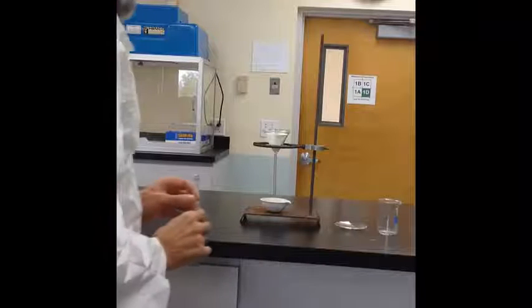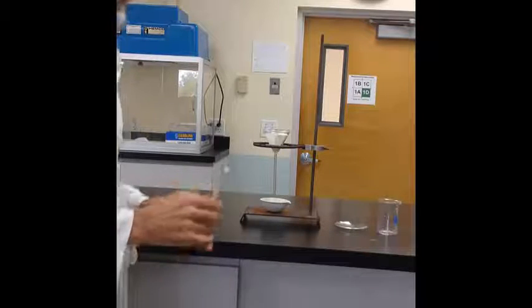Allow it to drain down all the way so that it stopped draining, and then we'll repeat that with a second portion and pour the second portion of hot water, 5 milliliters, over the top of the salt sand mixture as we did with the first. And then we'll follow that with yet a third portion of 5 milliliters of hot water poured over the top of the salt sand mixture.